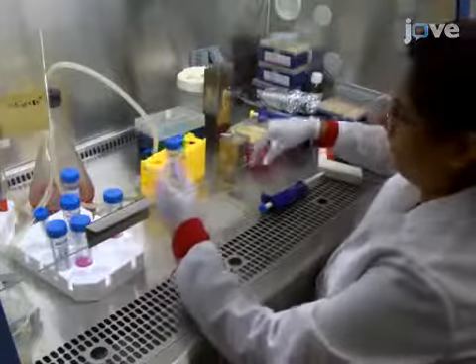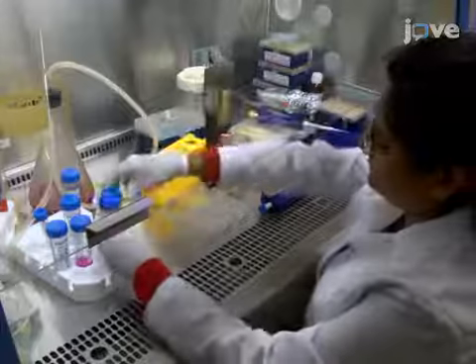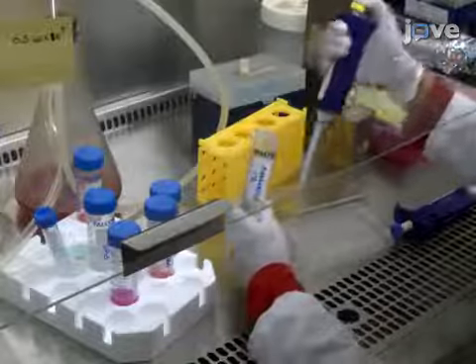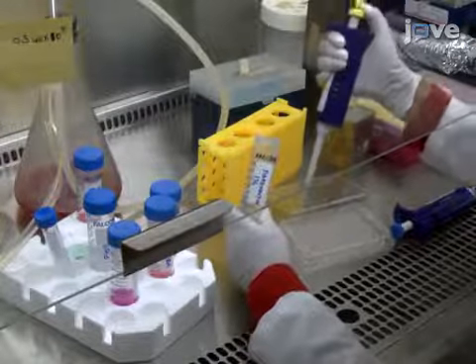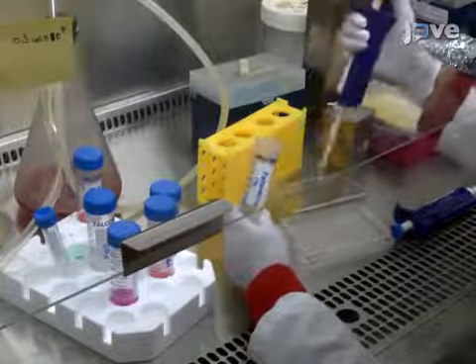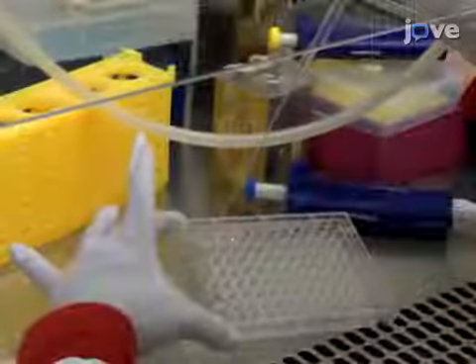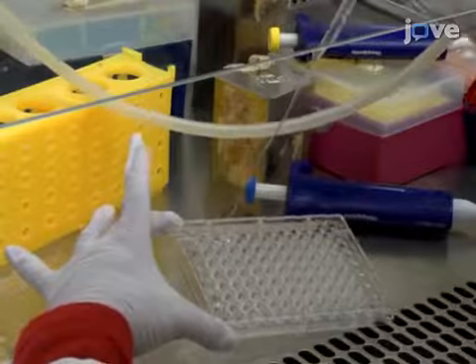To prepare cells for high-content microscopy, under a cell culture hood, use a 1% fibronectin solution in PBS to coat the wells of a 96-well plate. Incubate the plate in a CO2 incubator at 37 degrees Celsius for 2 hours. Aspirate the fibronectin solution from the wells.